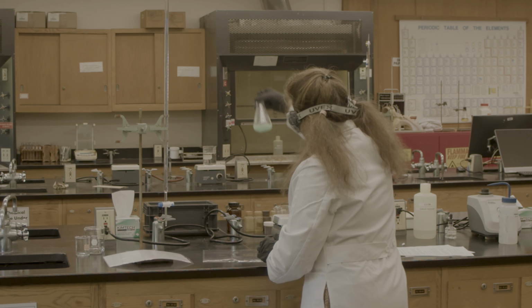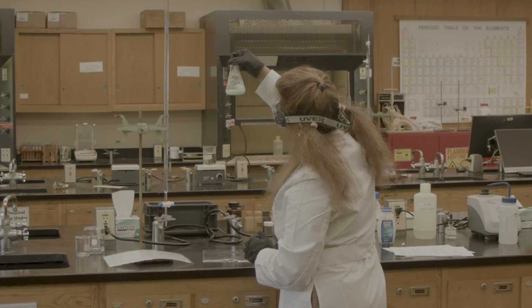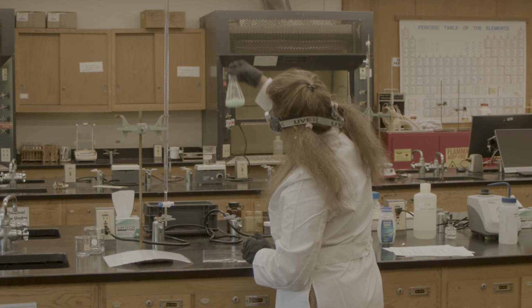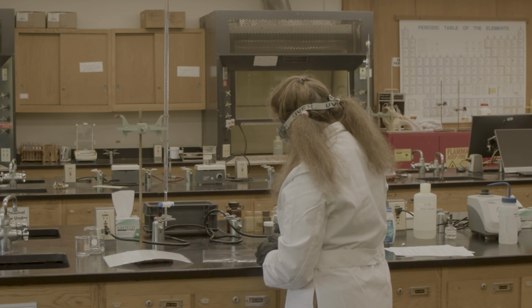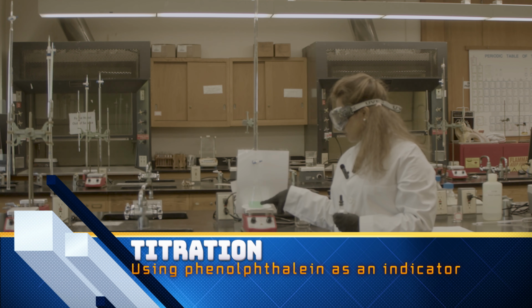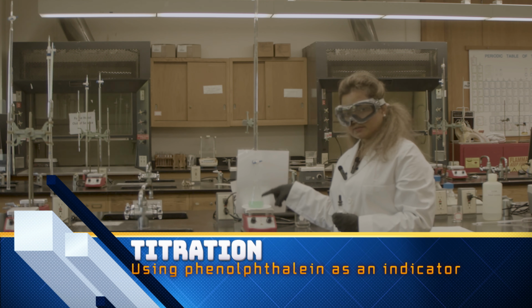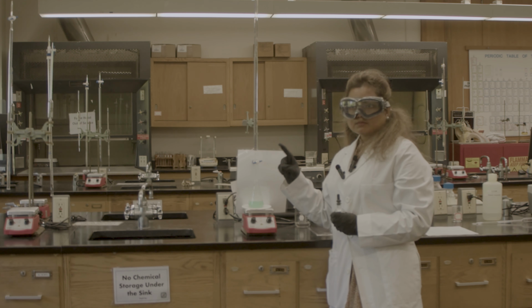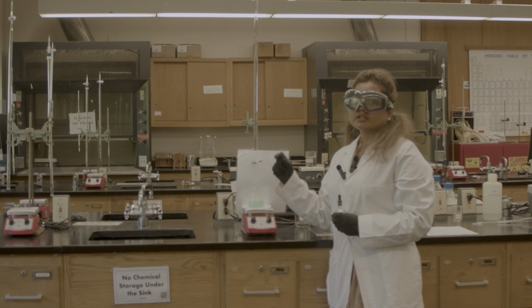Now, in the meantime, I can see that my antacid is almost dissolved. I crushed my antacid and diluted it with the hydrochloric acid. I don't want any carbon dioxide gas to react with my titration.